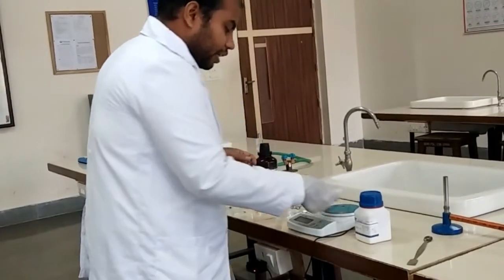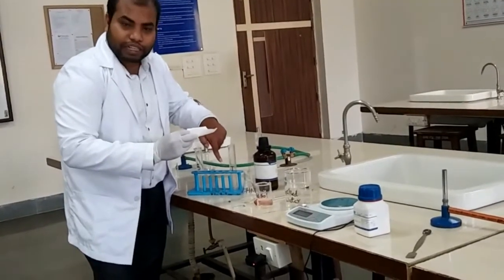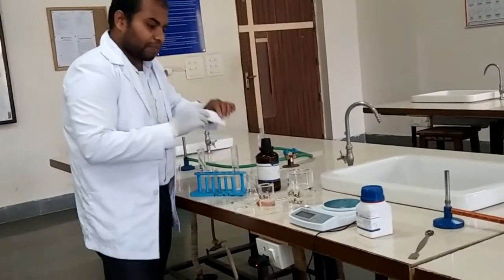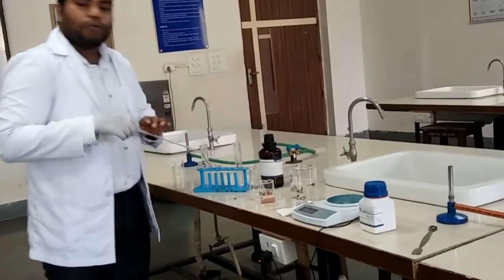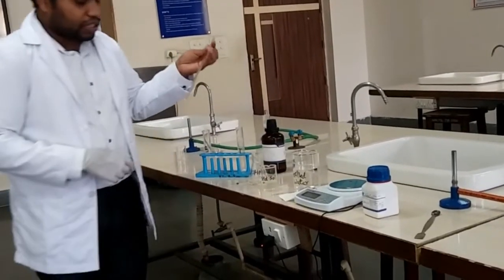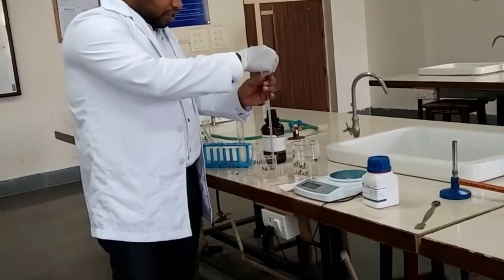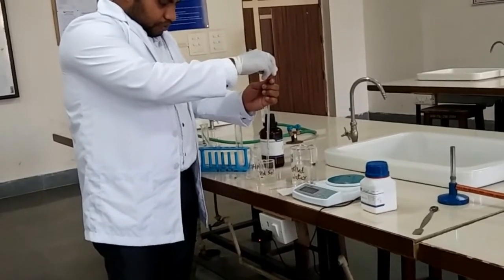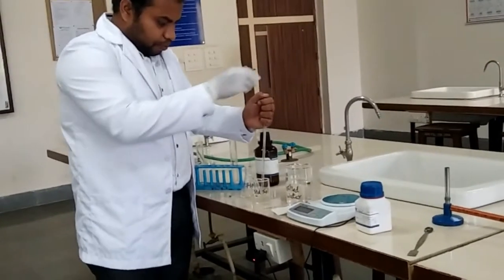We transfer the test sample into the test Nessler cylinder. For the standard Nessler cylinder, we use a 1 mL pipette with a rubber bulb to suck and transfer 1 mL of the standard sodium chloride solution into the cylinder designated as S.